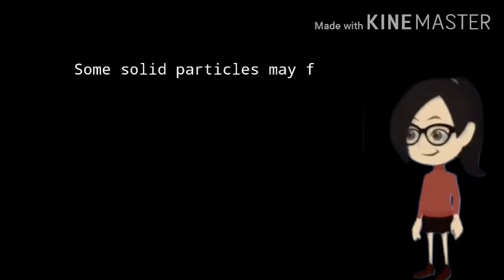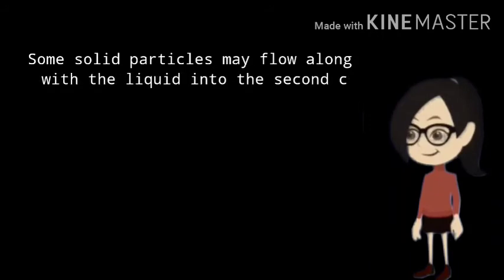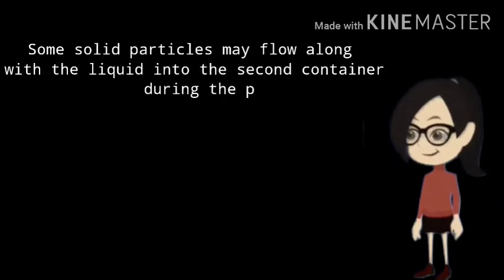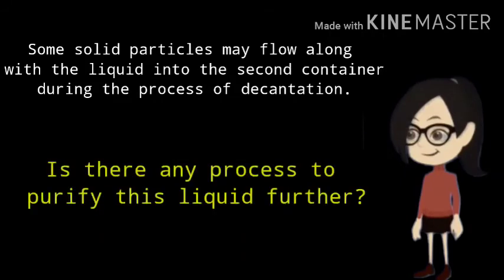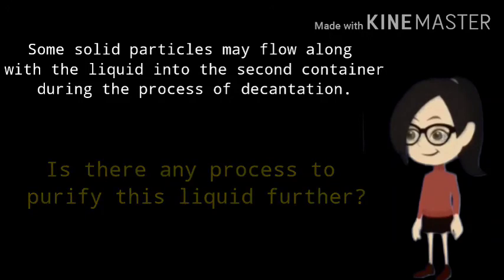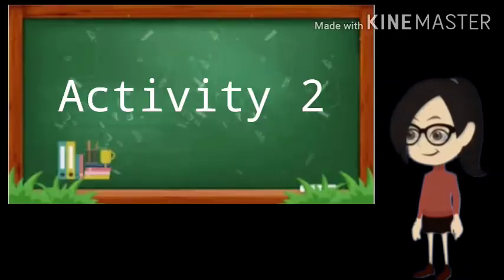During the process of decantation, some solid particles may flow along with the liquid into the second container. This liquid can be purified further by using the process of filtration. Now let us see the activity related to filtration.